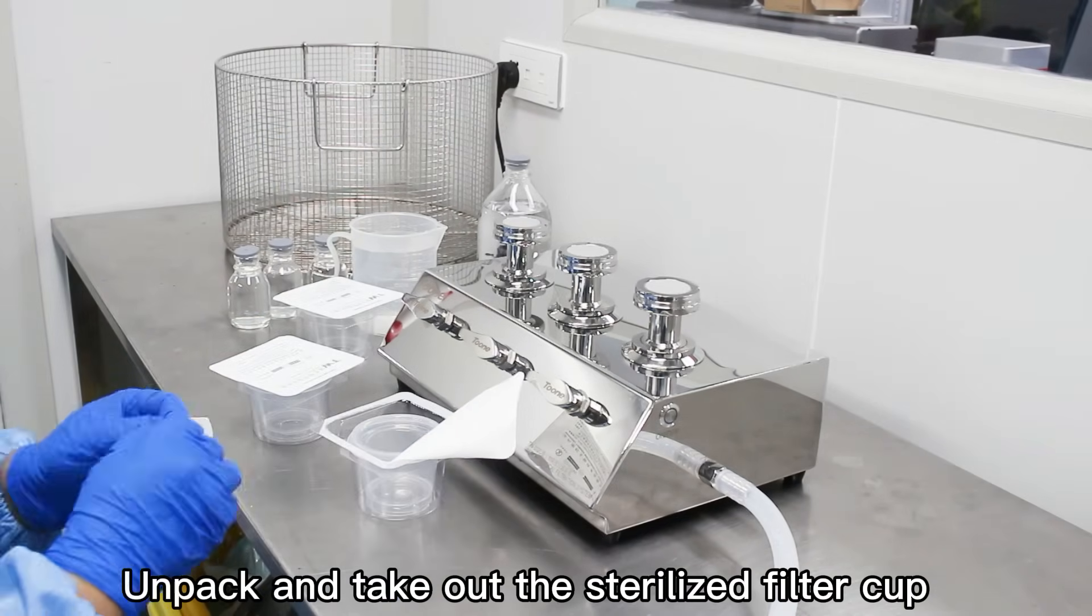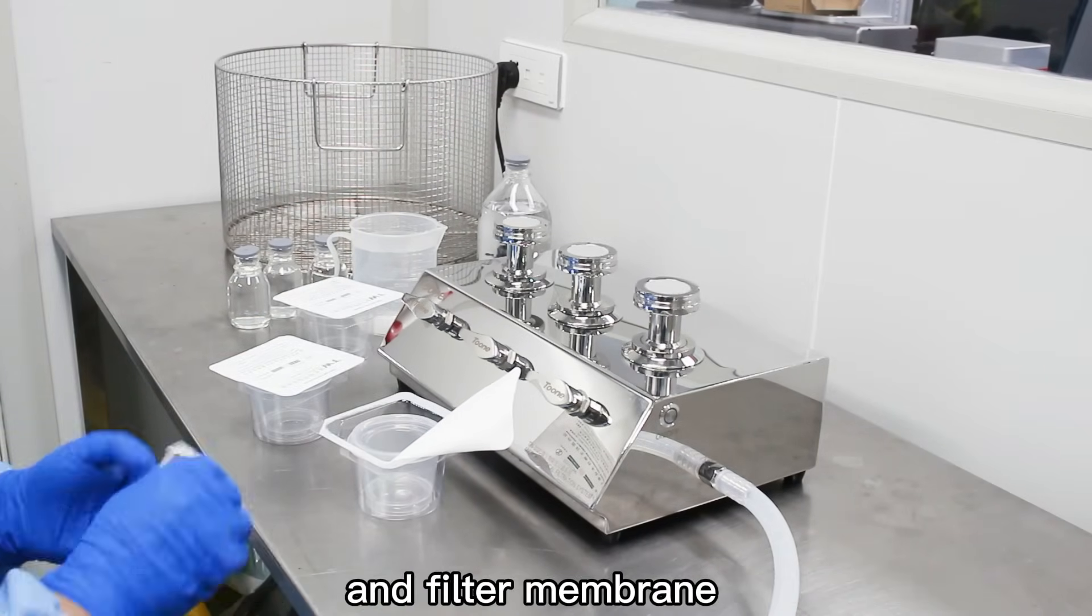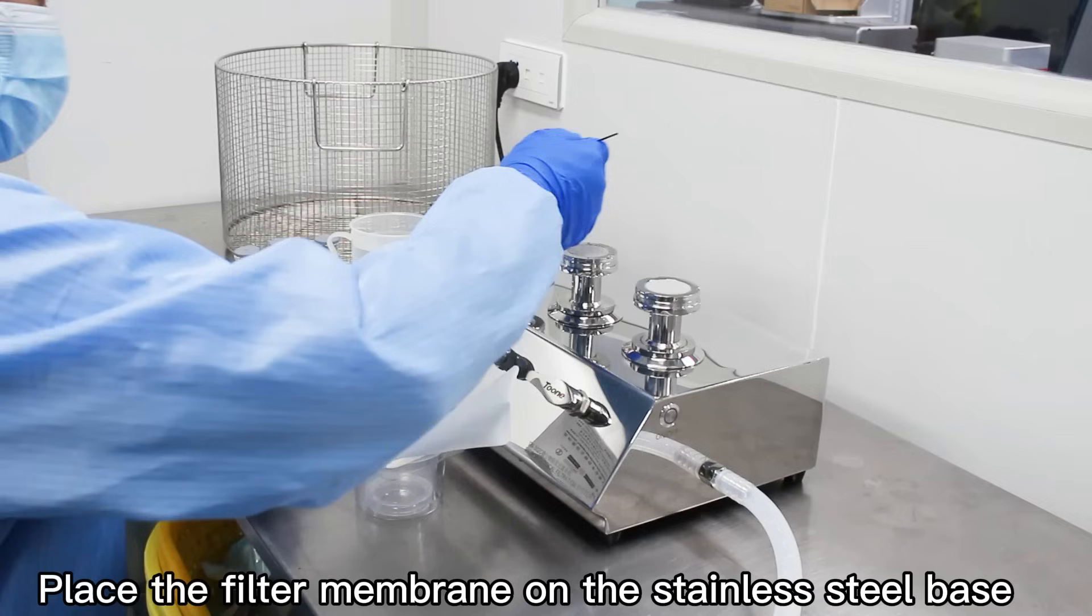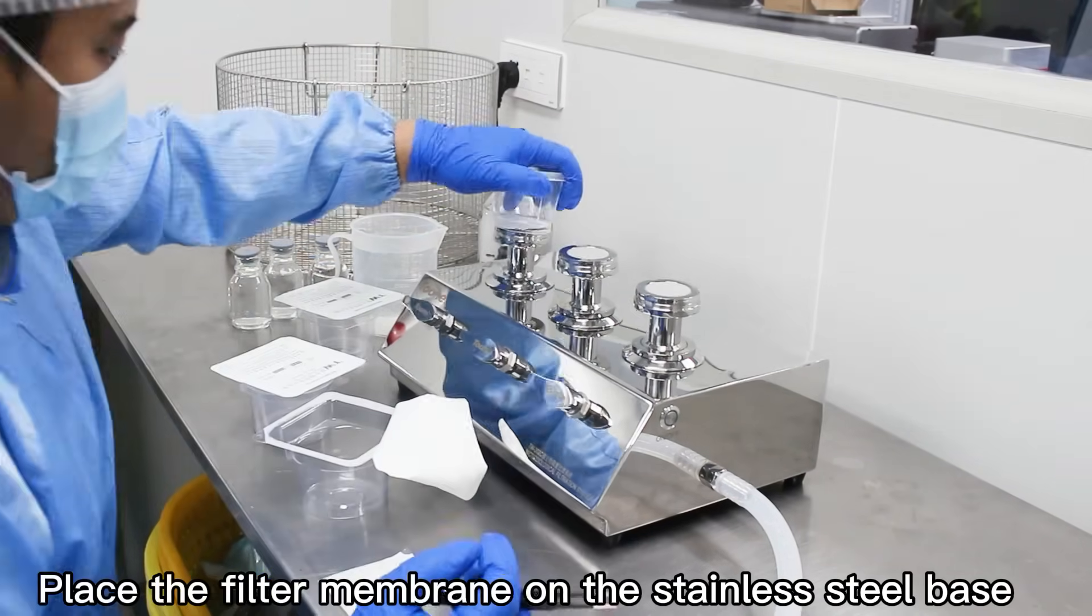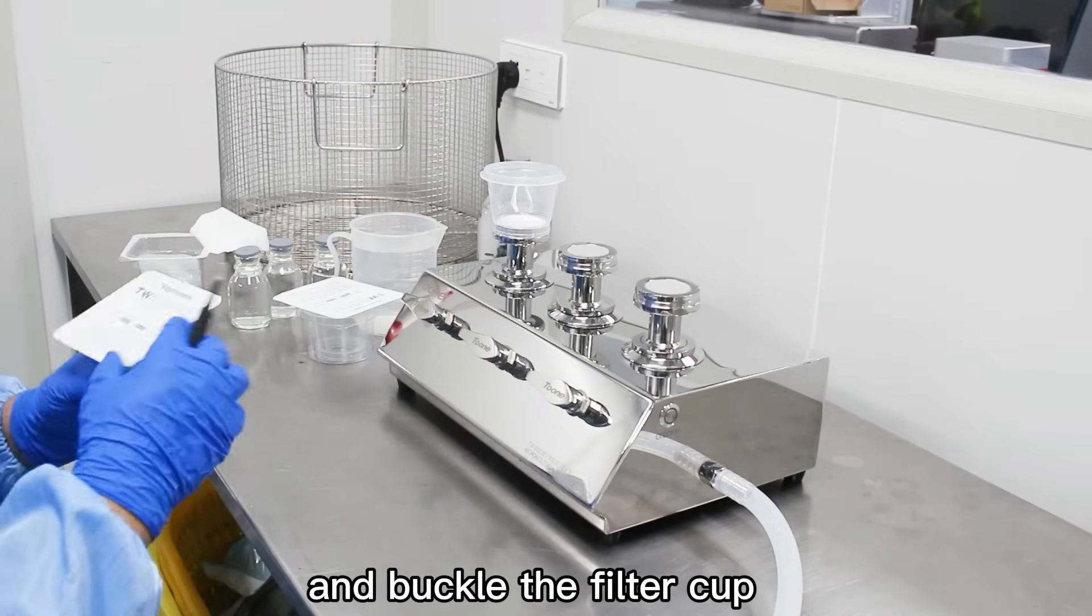Unpack and take out the sterilized filter cup and filter membrane. Place the filter membrane on the stainless steel base and buckle the filter cup.